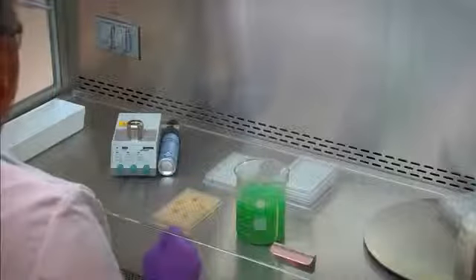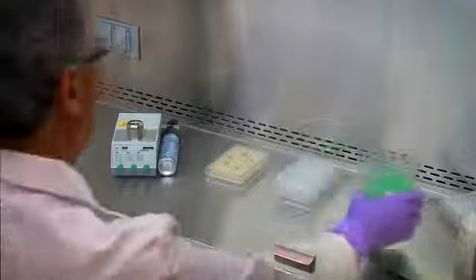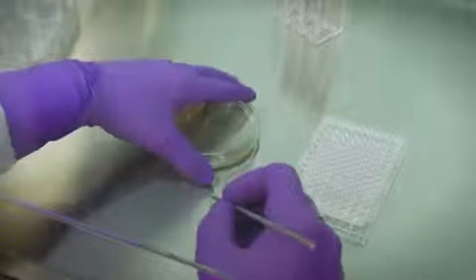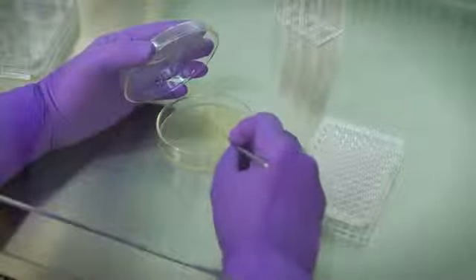The prevention of cross-contamination is imperative when working with sensitive and potentially hazardous material. Opened tubes or bottles should not be held in a vertical position. Investigators working with petri dishes and tissue culture plates should hold the lid above the open, sterile surface to minimize direct impaction of downward air.